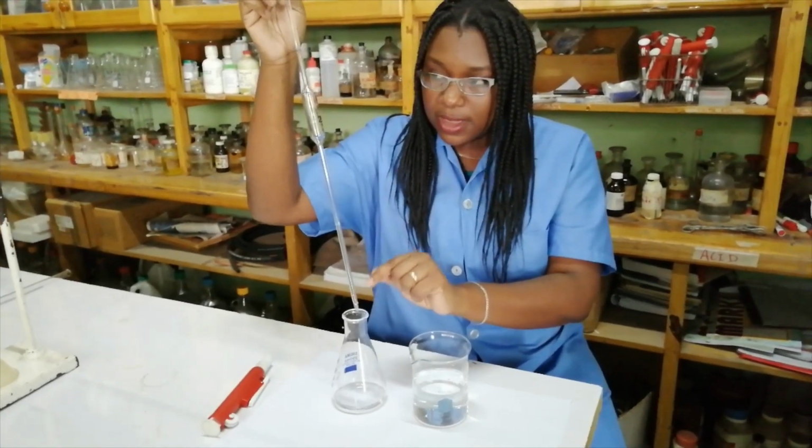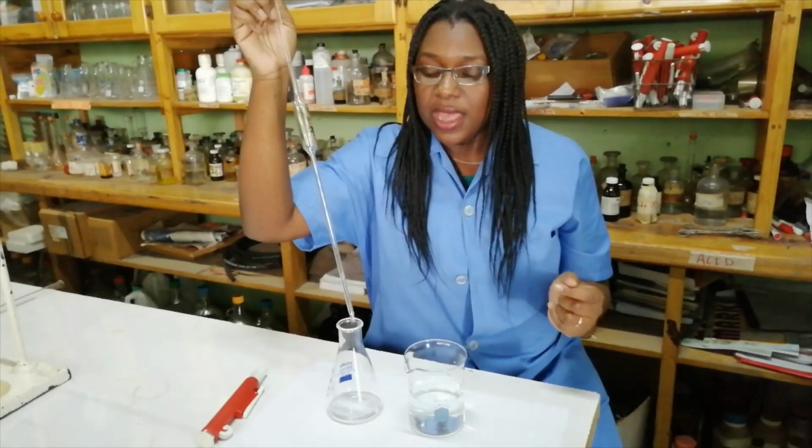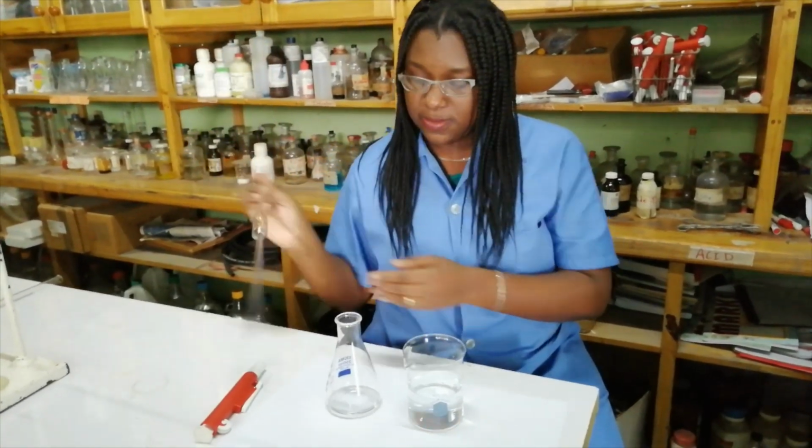This droplet right here is the error that's associated with the pipette. And that is how you use a pipette.